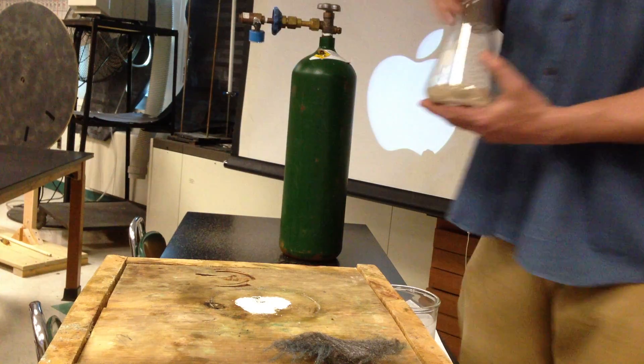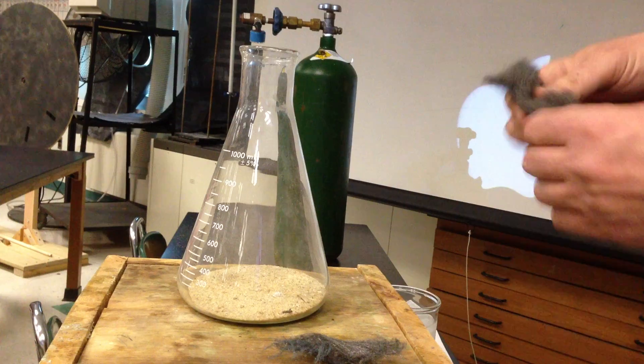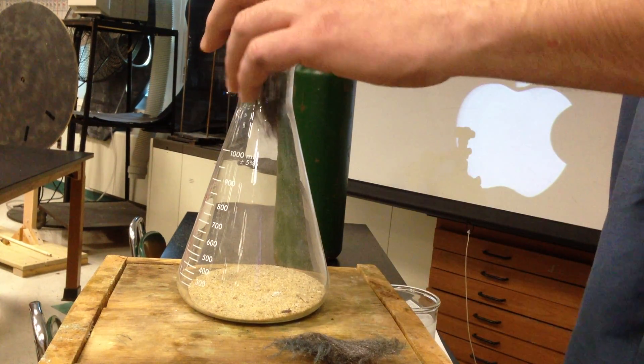And assuming my lighter works, we're going to put some of this steel wool into this flask and... wow!